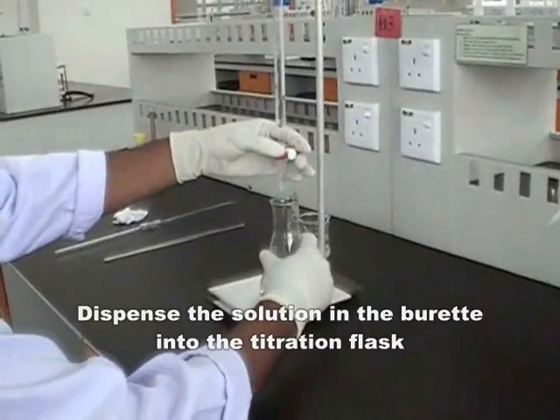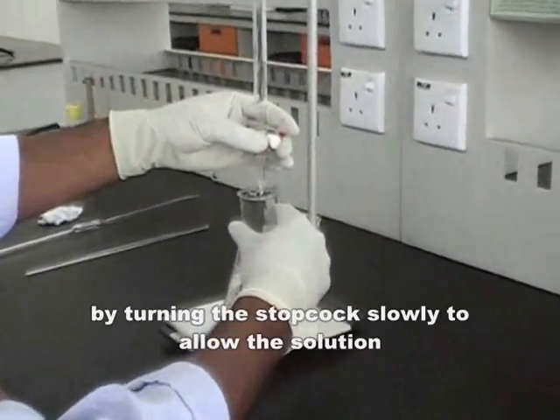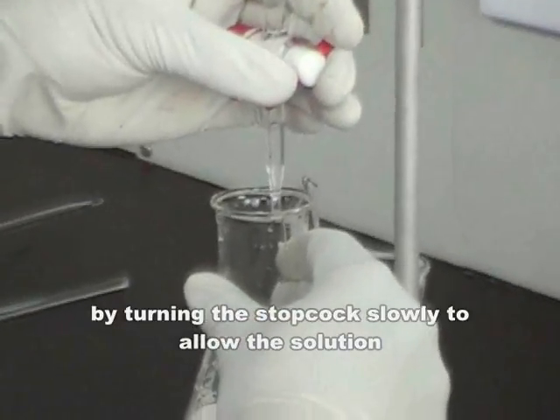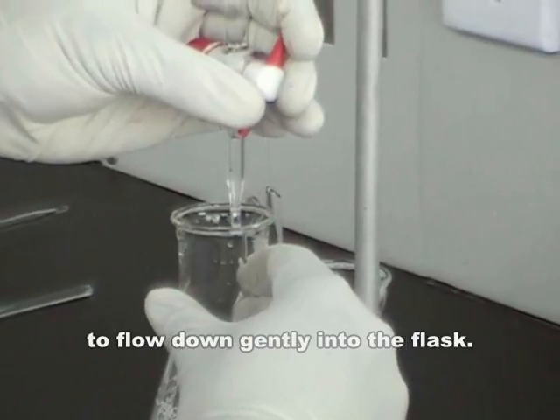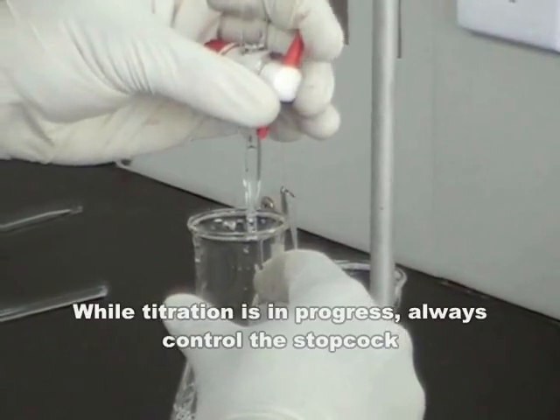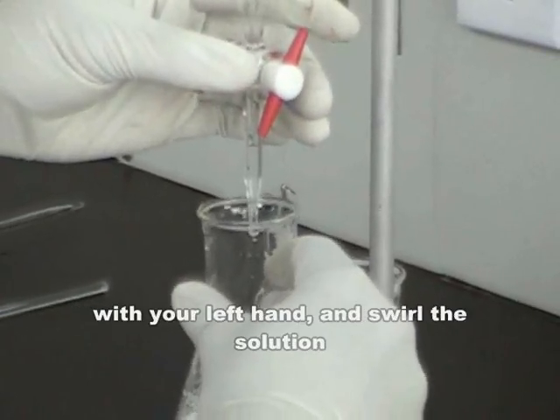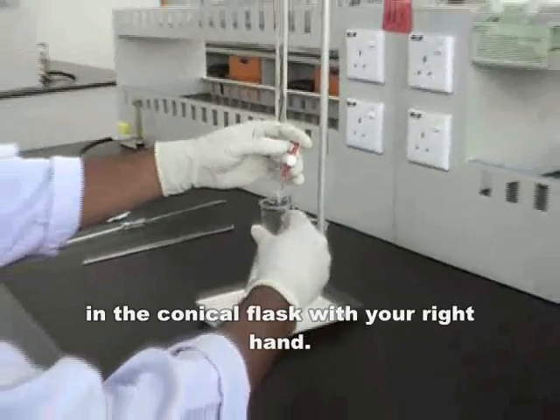Dispense the solution in the burette into the titration flask by turning the stopcock slowly to allow the solution to flow down gently into the flask. While titration is in progress, always control the stopcock with your left hand, and swirl the solution in the conical flask with your right hand.